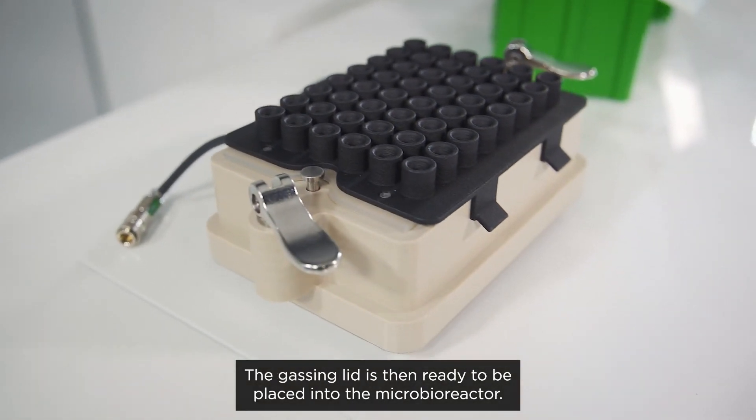The gassing lid is then ready to be placed into the microbioreactor.